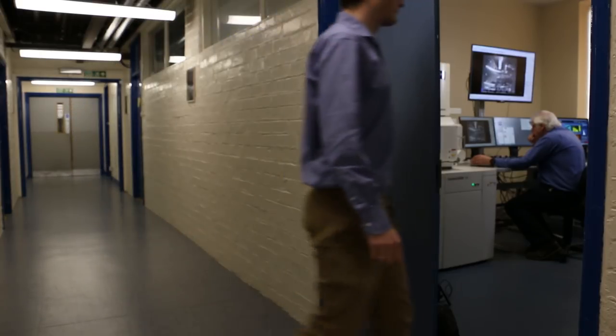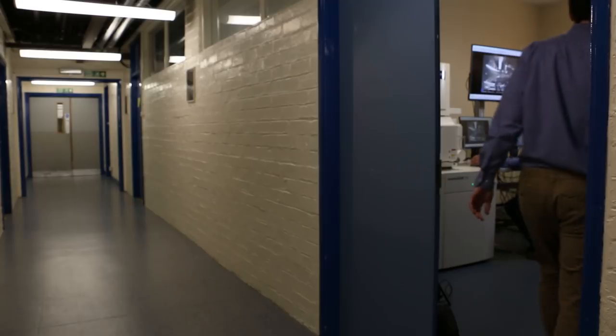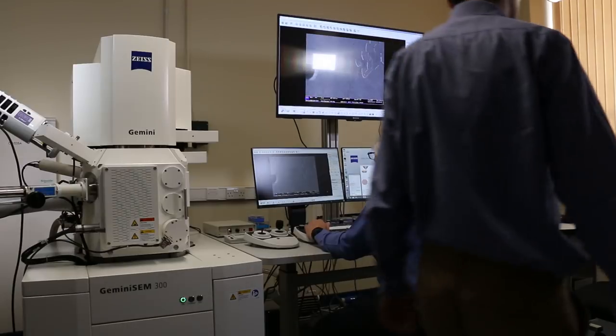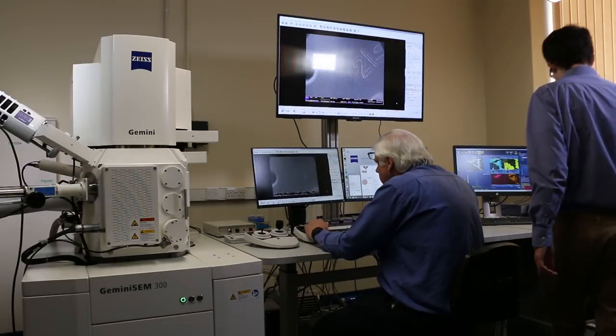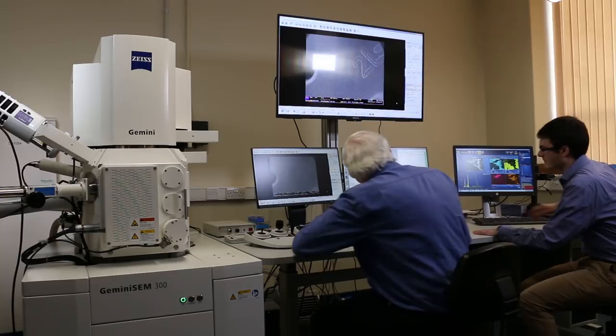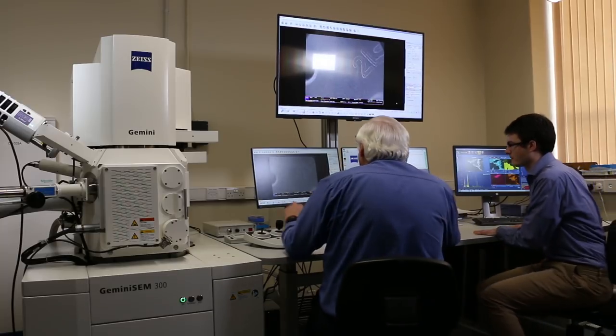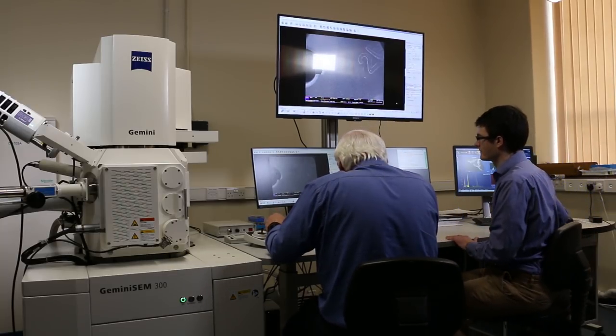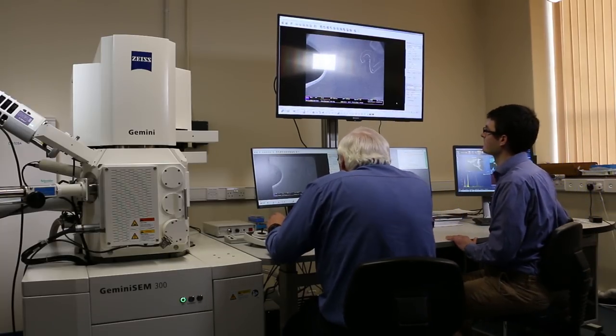Microscopy is looking at small objects. If you're looking at something that's the size of a hair, you can use light. If you want to look at something smaller than the hair width, you need to use an electron microscope.